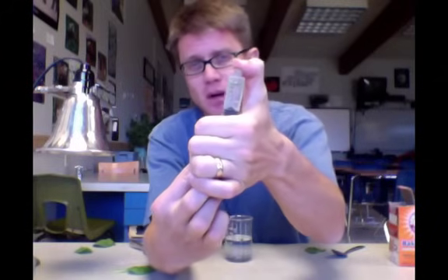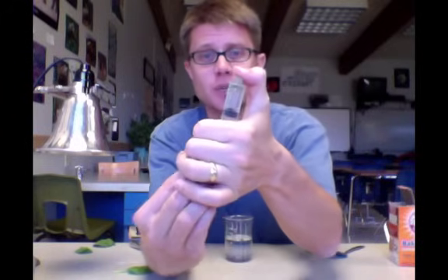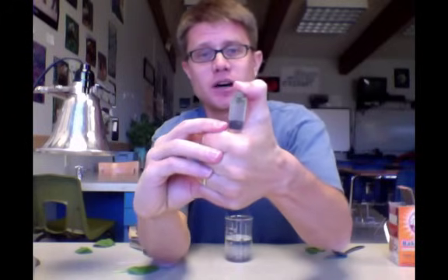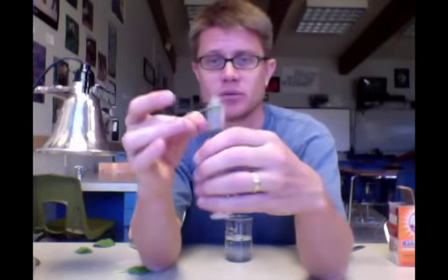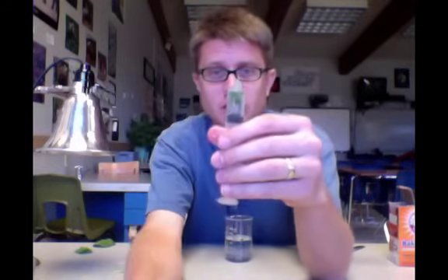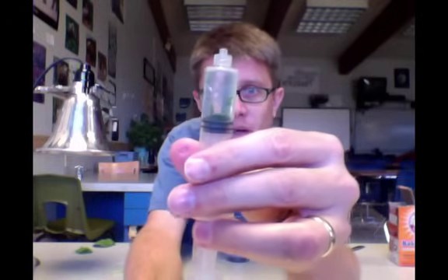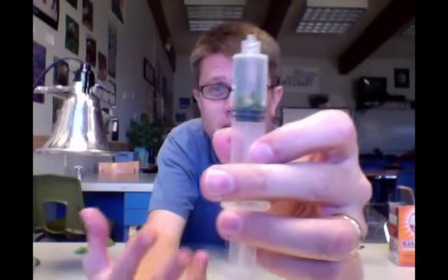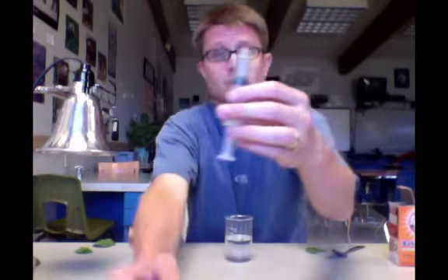As I do that I want to shake the leaves a little bit, and that's going to keep them in the liquid. What I'm doing is pulling that air out of the leaves. Now I'm going to push up keeping my thumb on it. If I do a good job the leaves are going to start to sink. You can see right now that the leaves are starting to sink to the bottom. Now what I've done is taken that air out and replaced it with water.